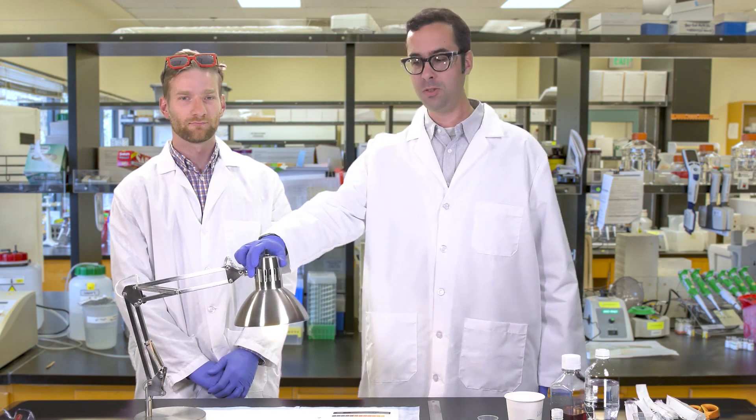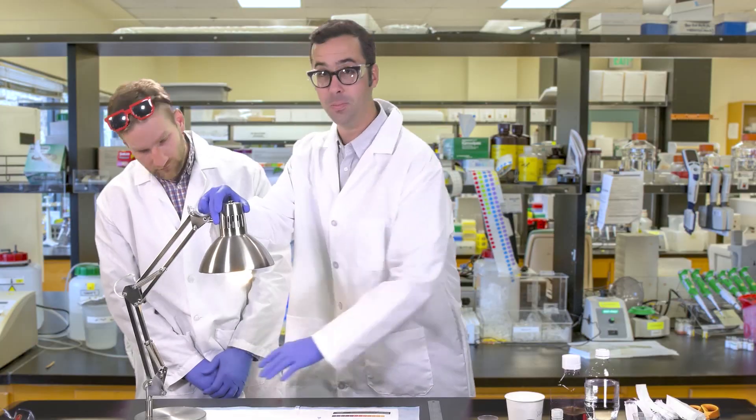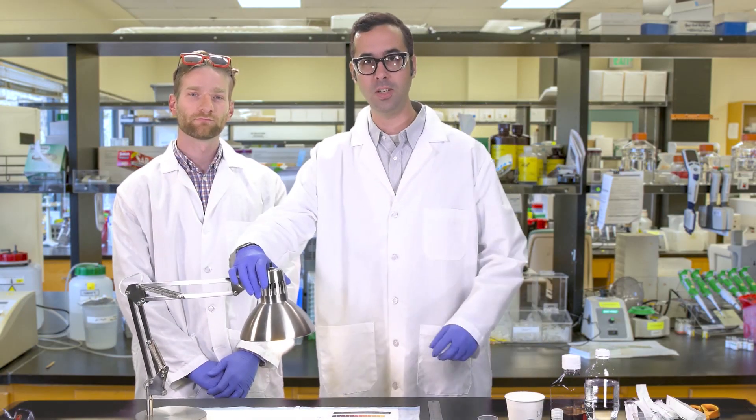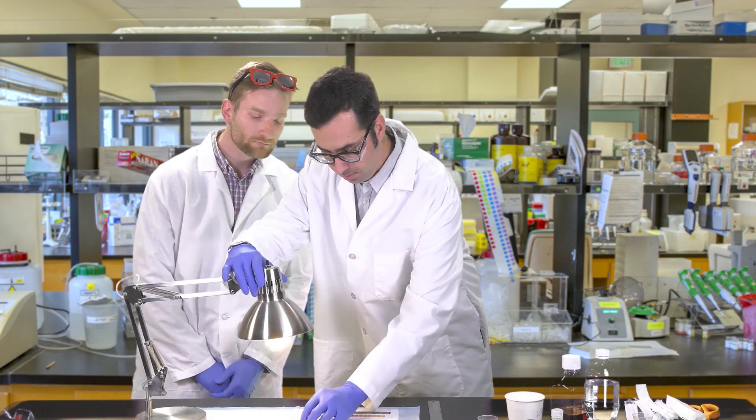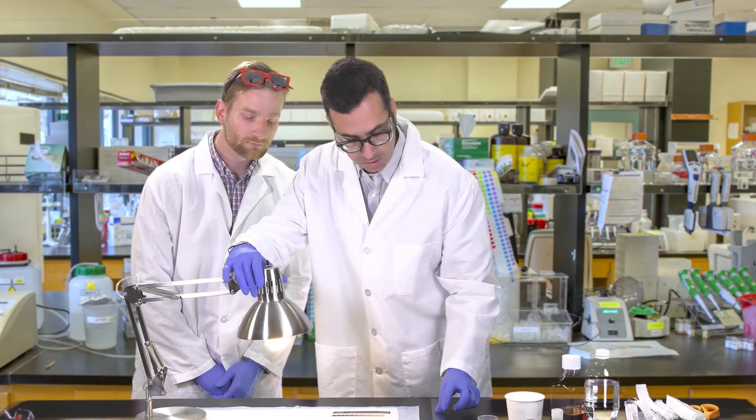Two, the light shouldn't be too close or too far from your beads. The cuvettes should be placed on their sides under the light, approximately 15 to 25 centimeters from the light source.